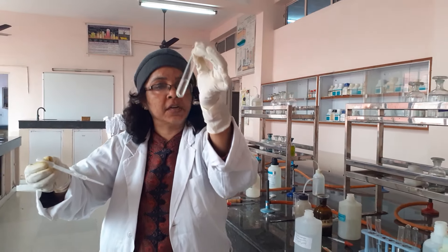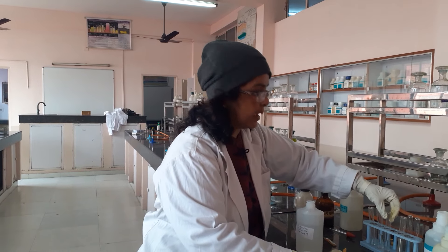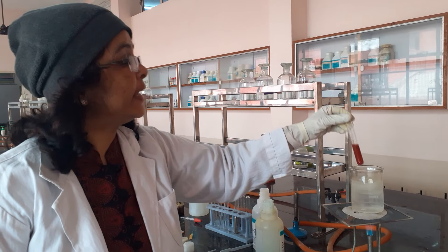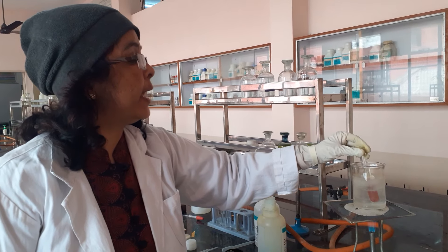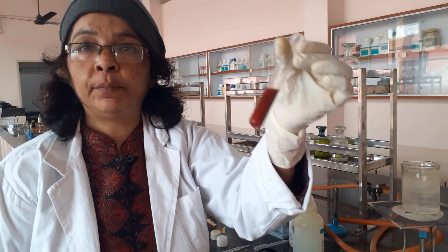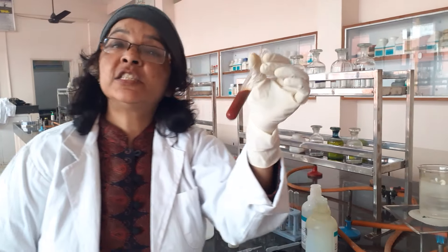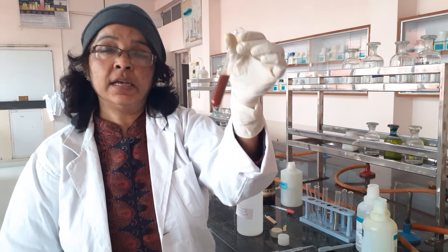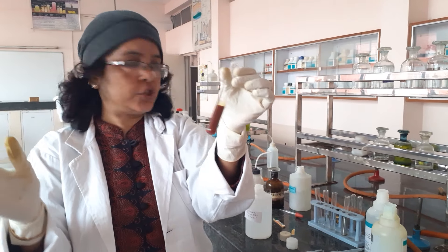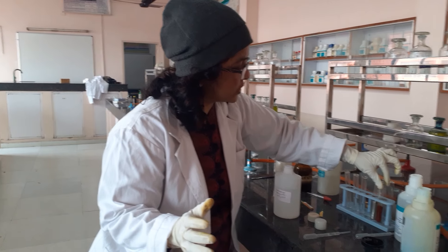Now let us observe the Fehling's test result. The Fehling's reagent with your aldehyde sample gives a reddish-brown precipitate, which is cuprous oxide (Cu₂O). So your blue color of Fehling's reagent has changed to a reddish color due to the formation of cuprous oxide — a positive result for aldehyde.